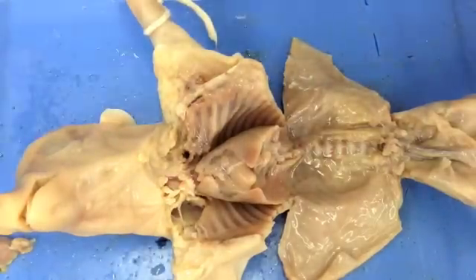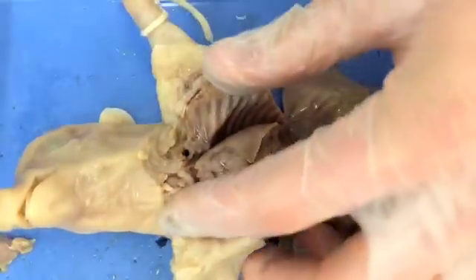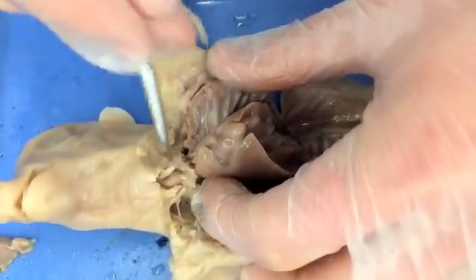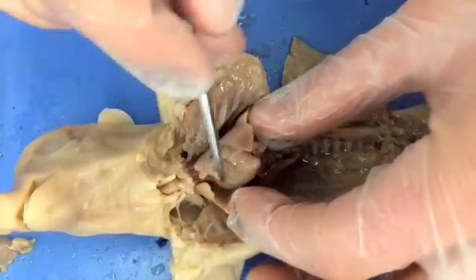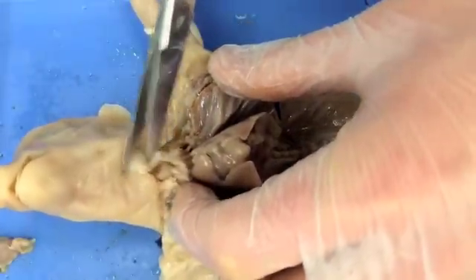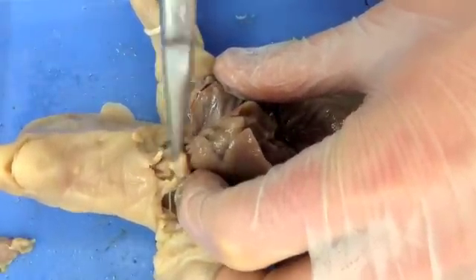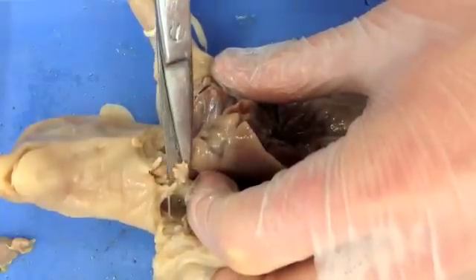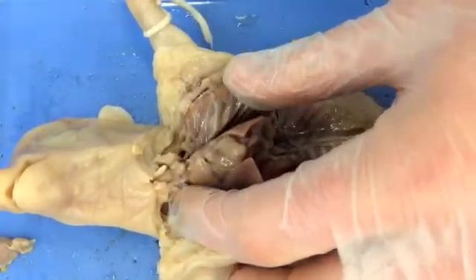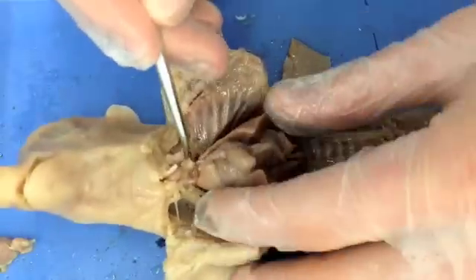Now we're going to move up into the thoracic cavity, or the chest cavity, and we're going to try to expose the trachea, the esophagus, so we can take a look at the heart and the lungs. This is a slow, delicate process. It just takes a little bit of time and some patience to move things. We've got a lot of layers here, so I'm just trying to tease back the layers a little bit.